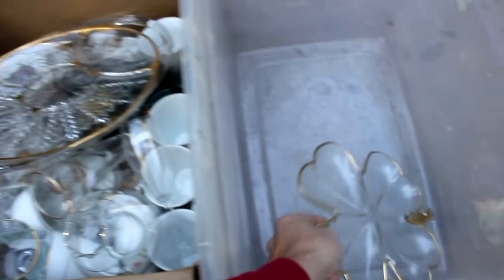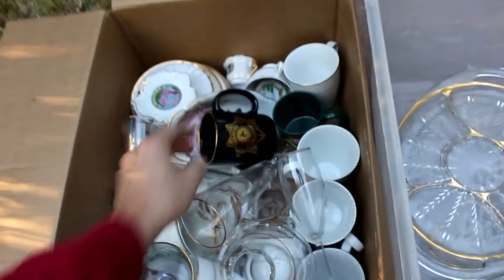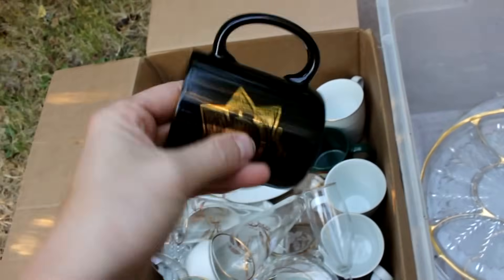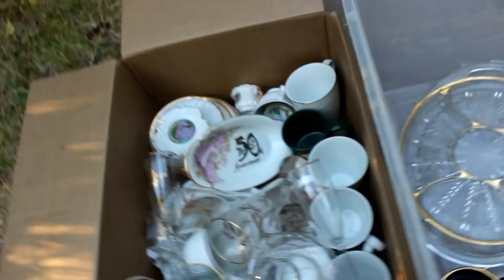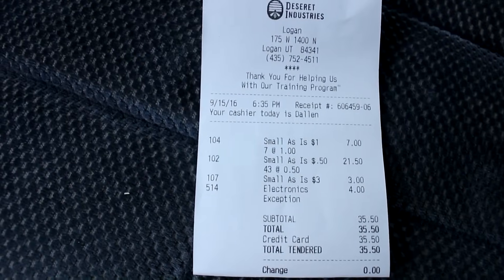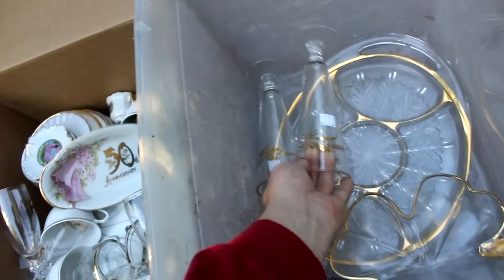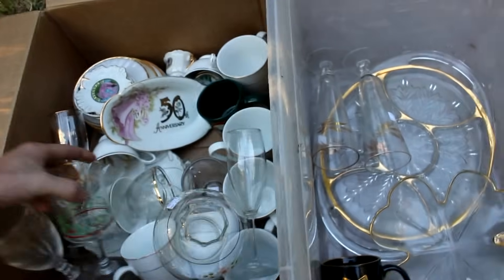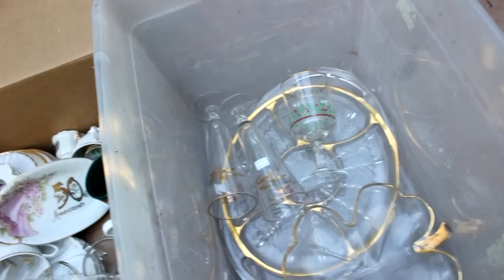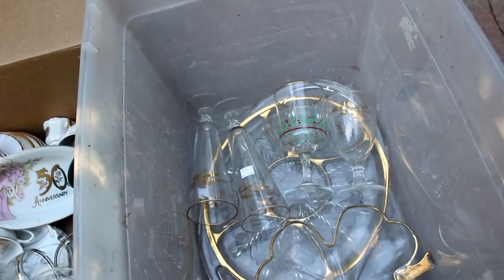So I've got the glass home and it's time to start extracting the gold from it. I think I spent about $30 total on all of these little gold-plated items. I bought a couple of other things, but here's the receipt. There's no way I'm going to make that much back on it — I'll be quite happy if I get $3 back — but the whole idea is to show you guys the process. It should be pretty simple. I'm just going to put them over here into this plastic bin.